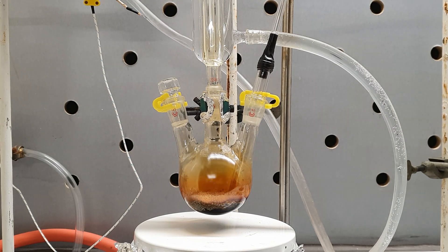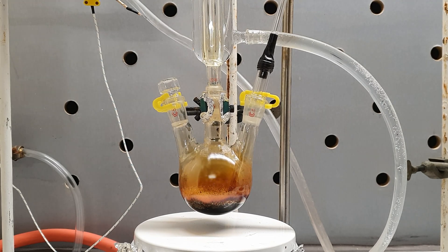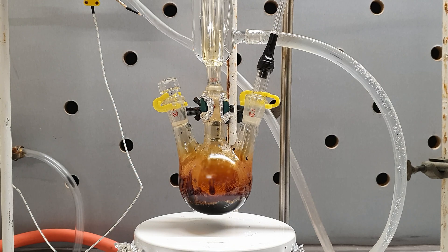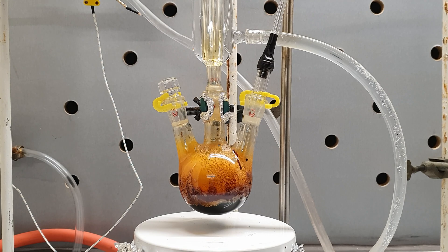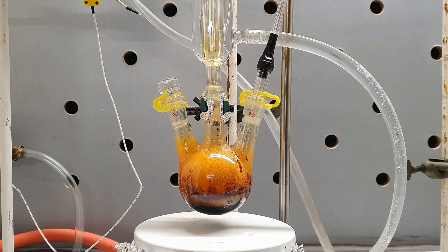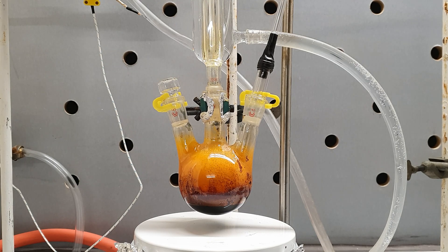The gas phase in the flask started to get browny as the product is formed. Soon the iodine started to liquefy. It is not actually melting since the reaction isn't that exothermic. It is dissolving in iodine monochloride forming on its surface. As I said, the reaction is probably the most beautiful I have done, so I am gonna let you enjoy it.